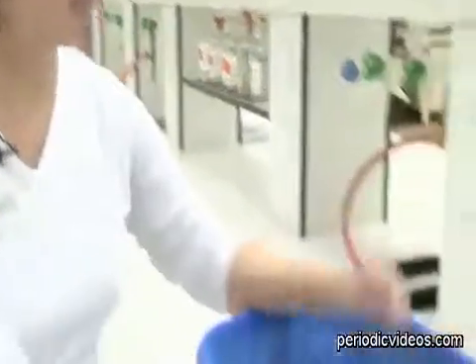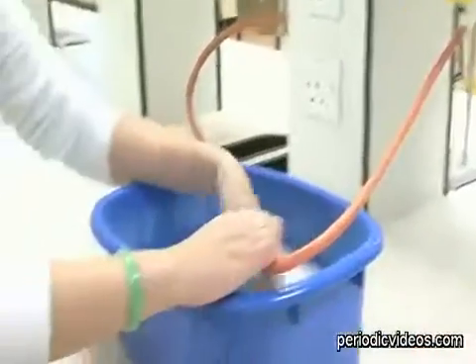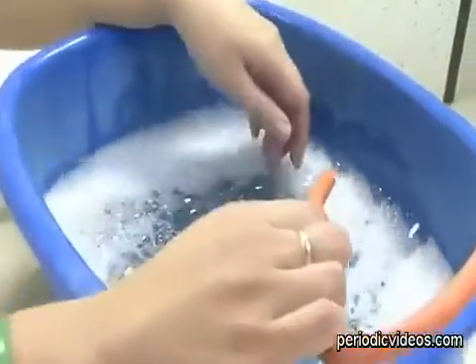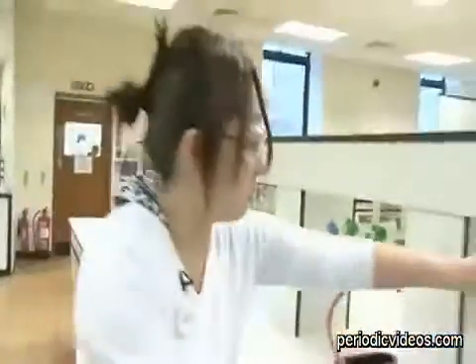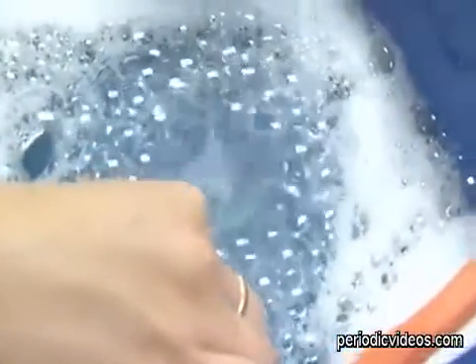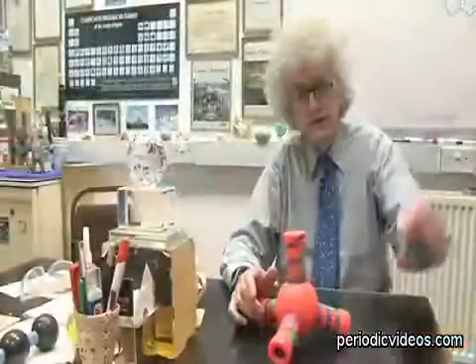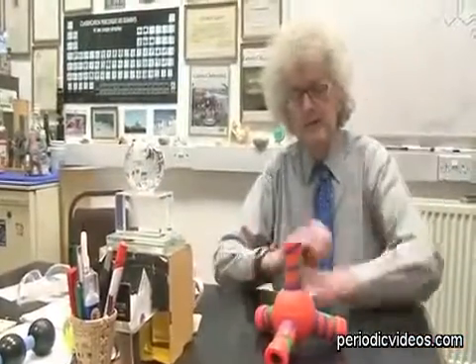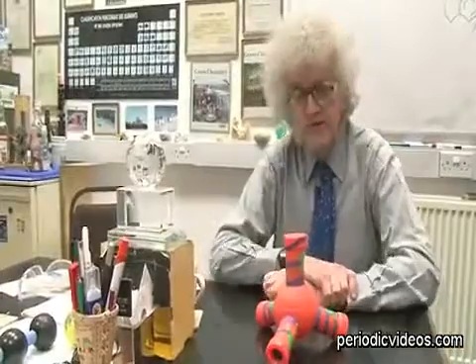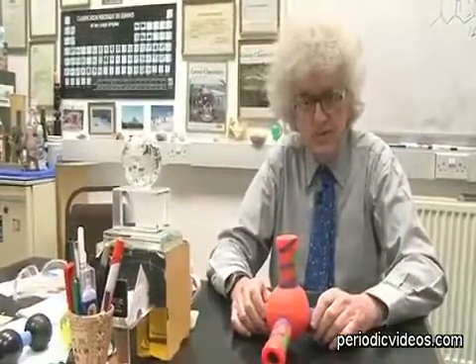So what we're going to do is actually use this to bubble methane gas into a soapy water solution, okay? So that's all it is, just a tub of soapy water. In it goes, tap goes on. It is the basis of so-called natural gas, the gas that's found deep in the earth and which you can drill down and recover. It's used for heating and energy all over the world.